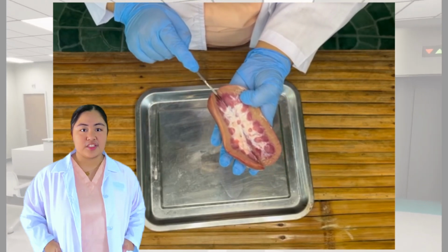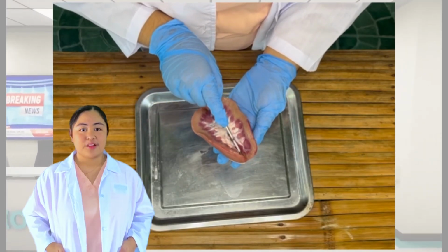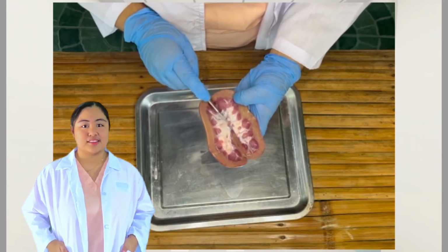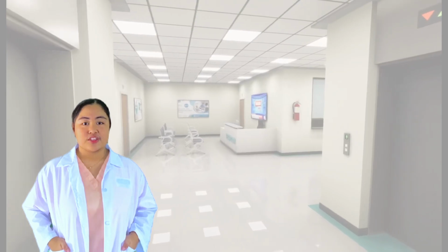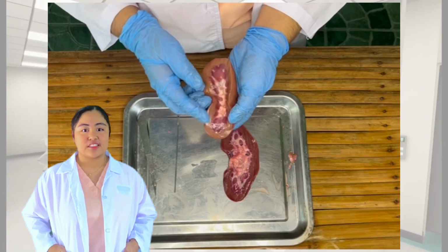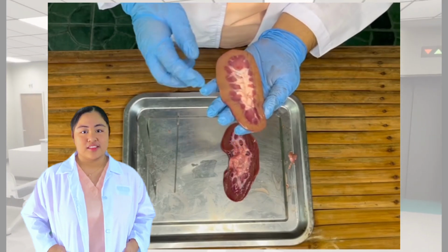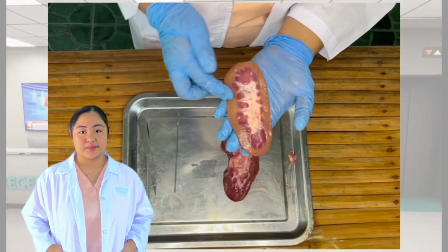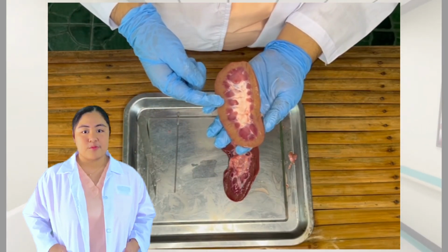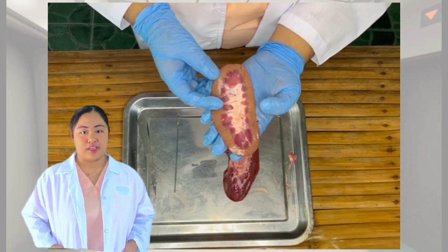After cutting, we should end up with two halves, one anterior and one posterior. Now that it is already opened, let's discuss the features that we can see with this dissection. First, you should be able to notice that on the outer part of the kidney, there is a highly vascularized area that extends from the renal capsule. This part is called the renal cortex. The deeper part that includes the renal pyramids, those somewhat triangular structures, and the calyces would be the renal medulla.